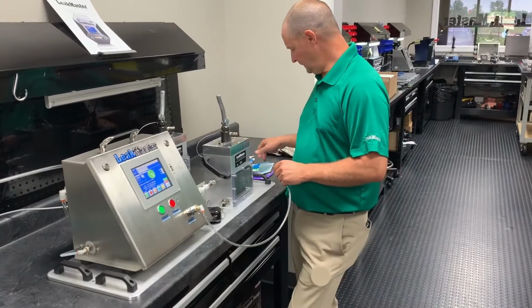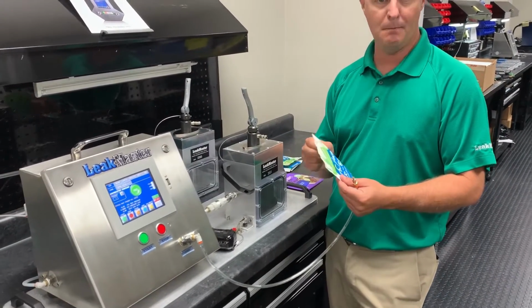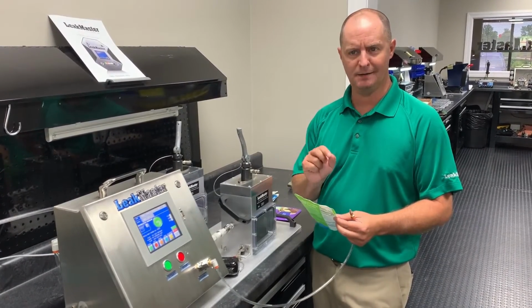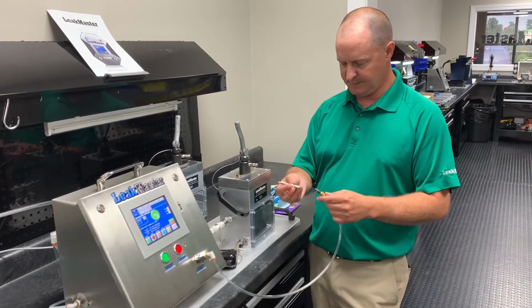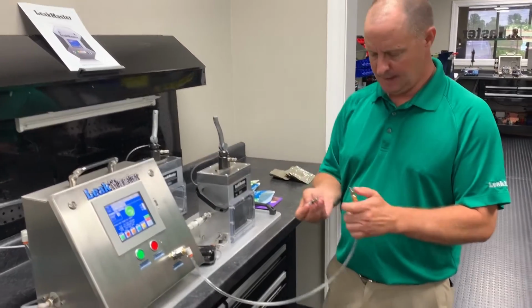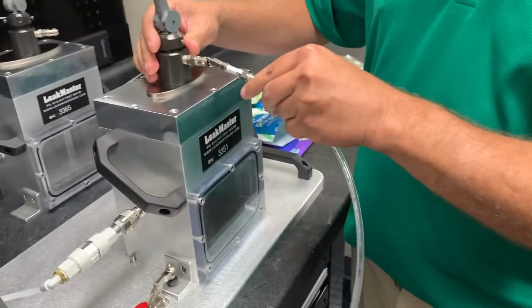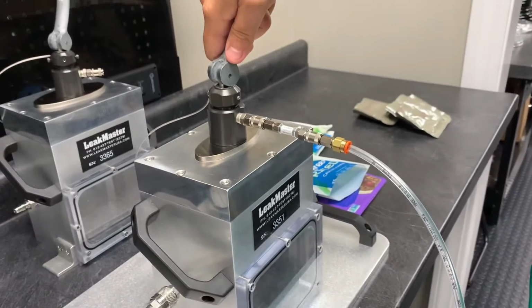All right, so with this type of product, it's very hard to replicate a very marginal leaker, an extreme small pinhole that's barely going to leak any contents out. So what we've done is we've just manufactured a calibrated leak orifice. We've got some quick connect fittings on here. And this will be the method that our customer uses to verify that their system is actually working and can catch a micro-sized leak.